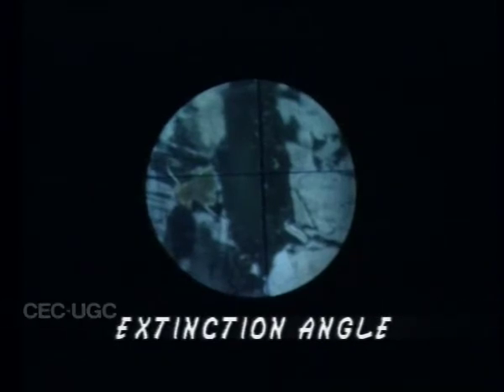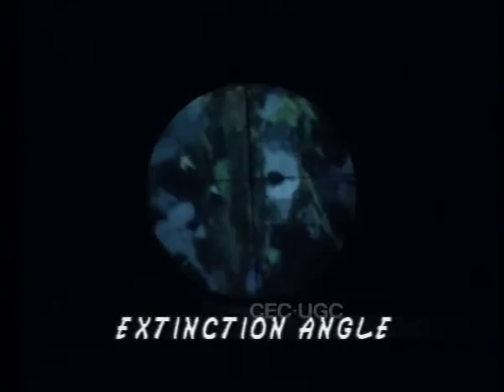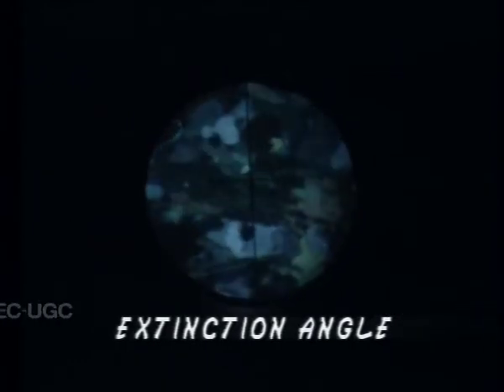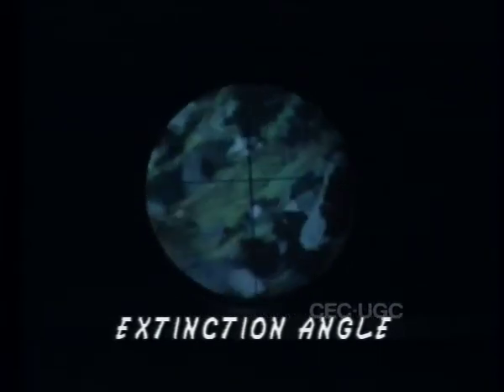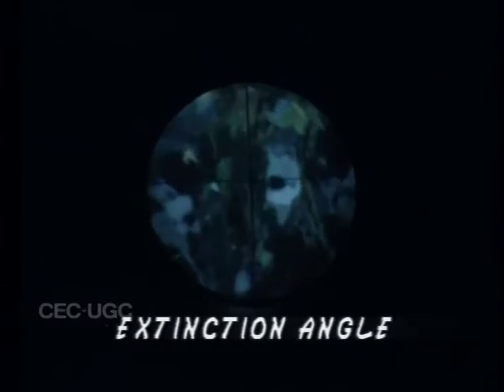Tourmaline, being a trigonal mineral, shows straight extinction. Biaxial minerals belonging to orthorhombic system will also show straight extinction. In other biaxial minerals, it is seen that at extinction position, cleavage lines or other such reference lines are oblique to the hairlines.